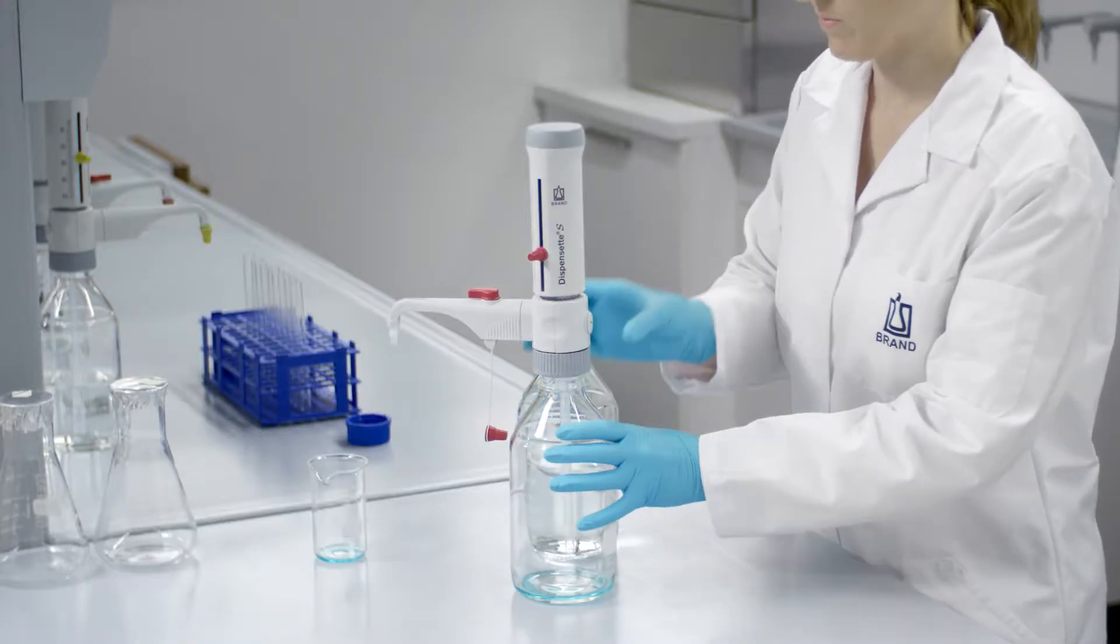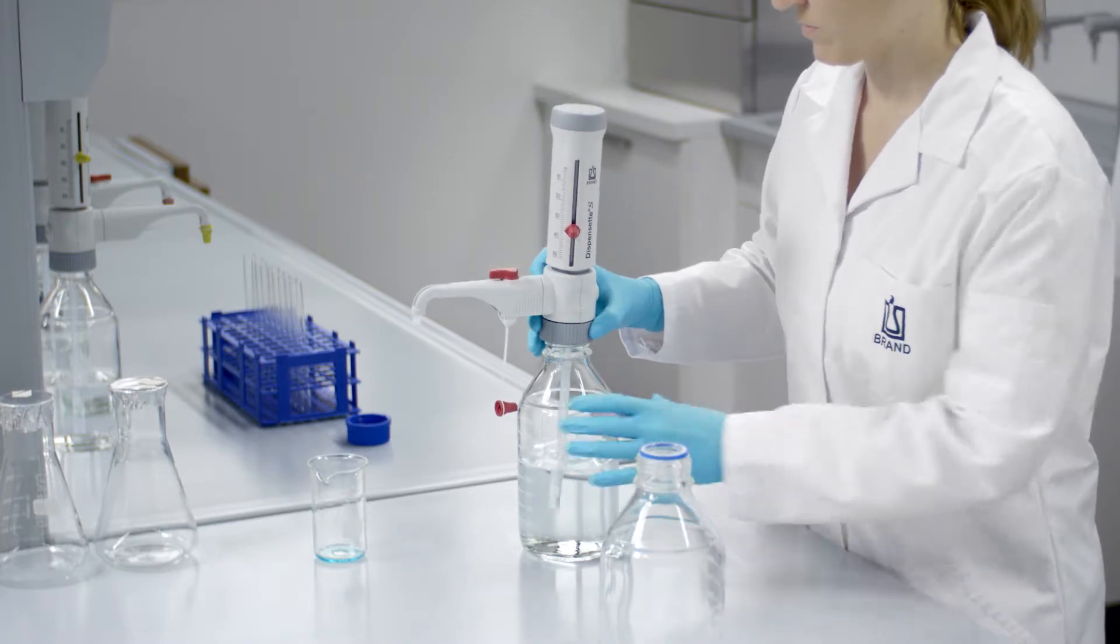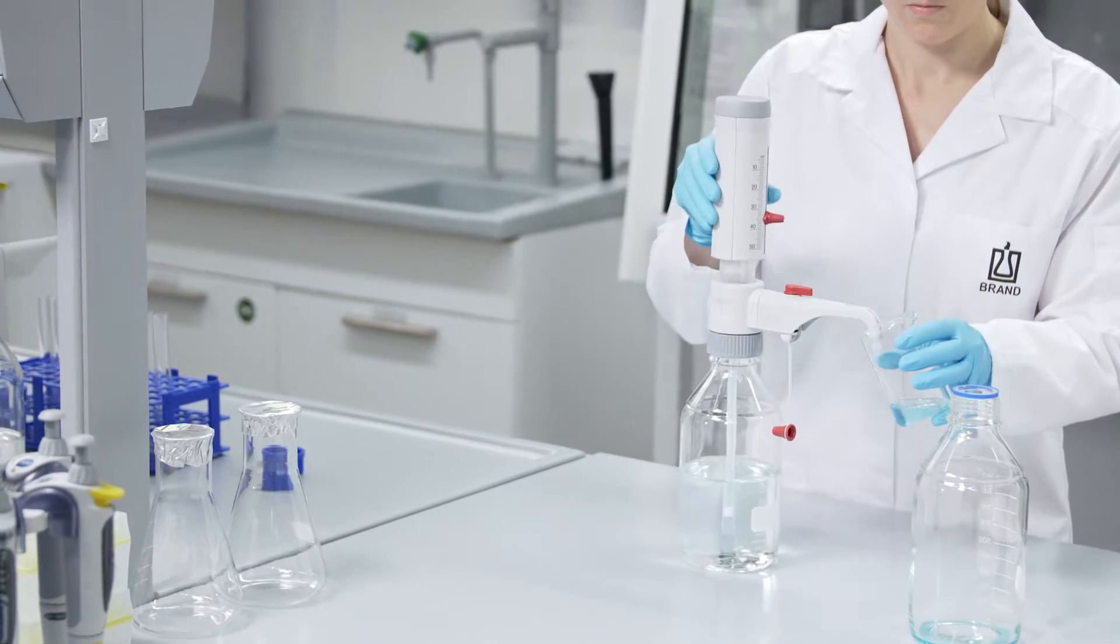Mount the instrument onto a bottle filled with a suitable cleaning agent, for example deionized water, and rinse the instrument thoroughly by repeated filling and emptying.